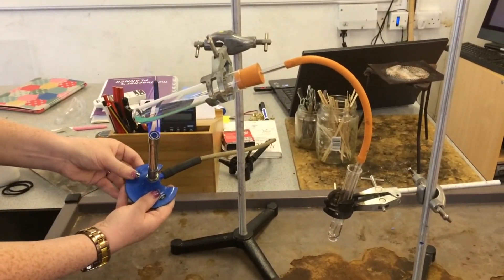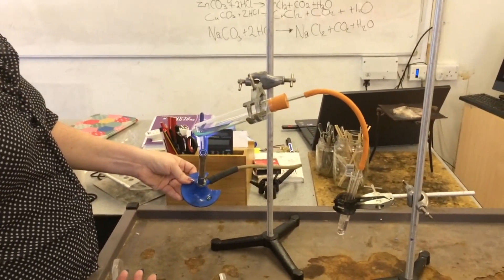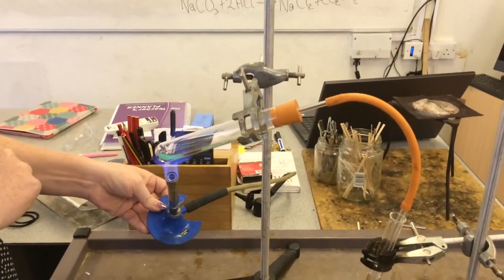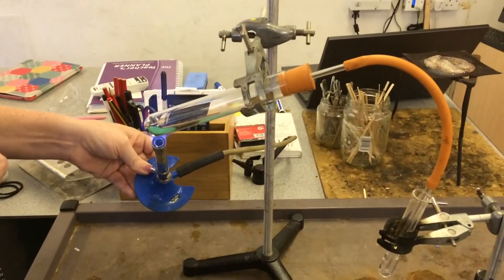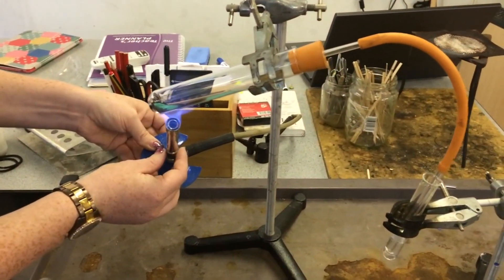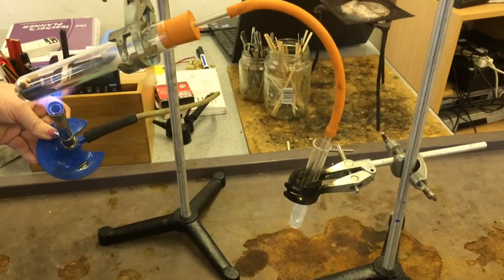I've only been heating it a little bit and already we can see that there are bubbles coming through. As the copper carbonate decomposes, we're going to end up with copper oxide and carbon dioxide. You can see here that this is starting to go black — the black is going to be the copper oxide that's produced. That's happening really quite quickly now, and we can see the lime water down here is starting to go cloudy.